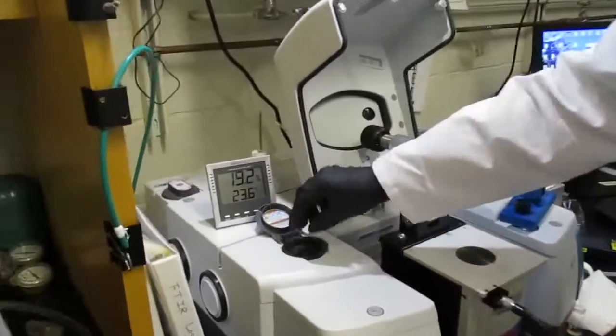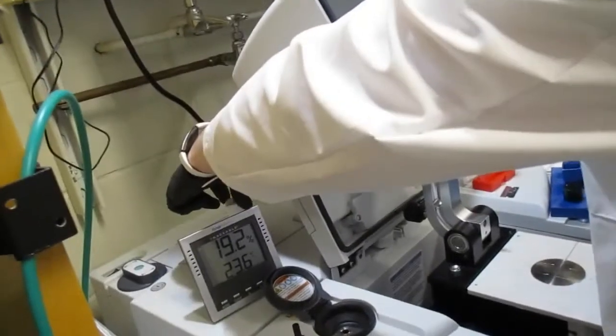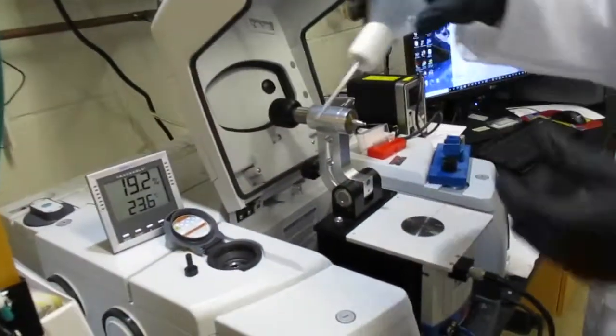So you simply open this up, take out the cap, and then there's a funnel in the back, which is usually where we keep it.